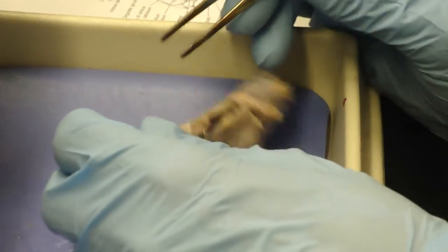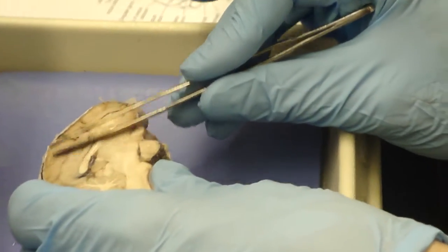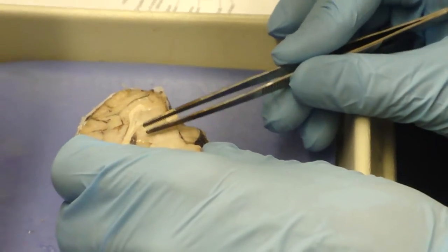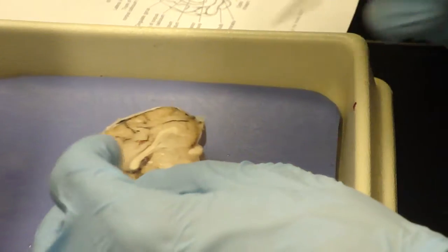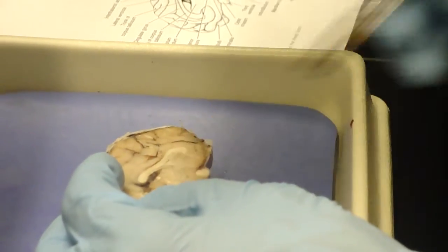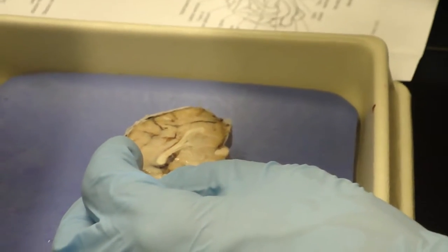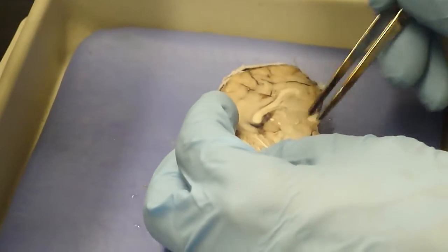It's very hard. Well, I better go over parts of the brain. So we have the cerebral hemispheres, a bit more of the forebrain here, and then we have parts of the midbrain right in here. This is the, let's see, have I got it right? No, that's not the pineal gland. This is superior colliculus.